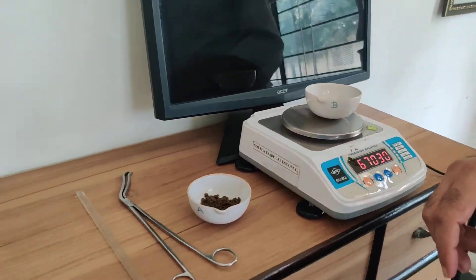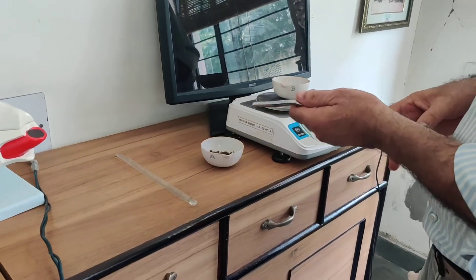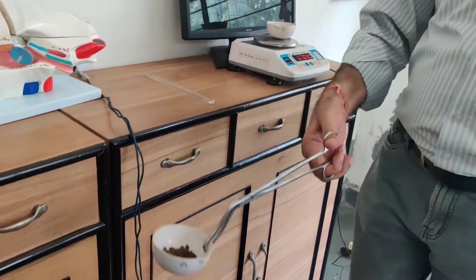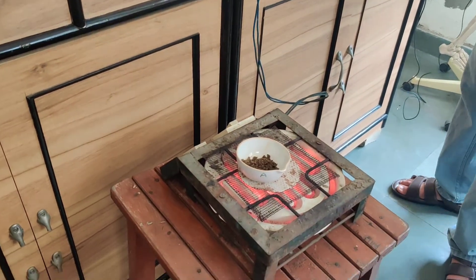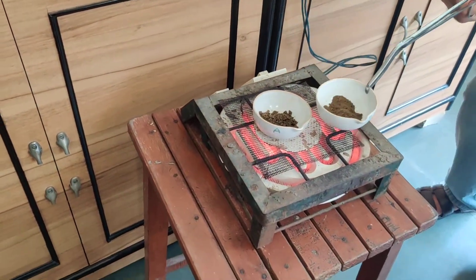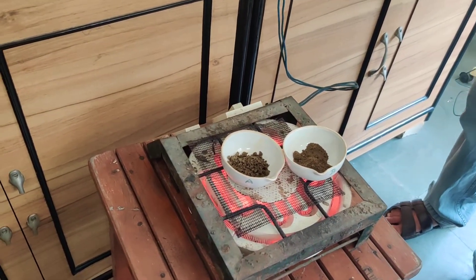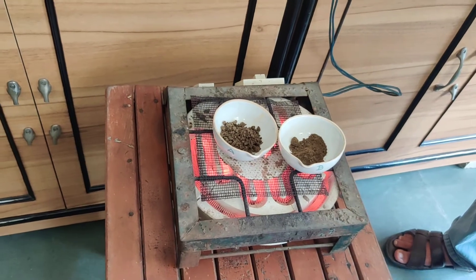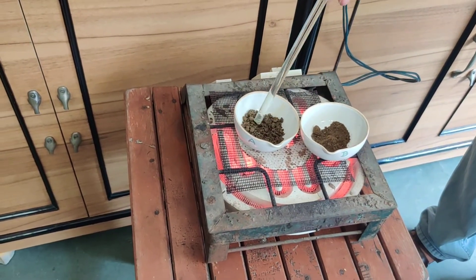Now what we have to do is make these soils dry on the heater. We will put one crucible on the heater, and this is the second one. Do it carefully. With the help of a stirrer, you will make it dry.